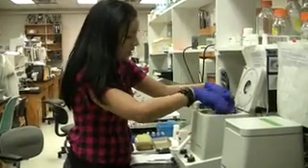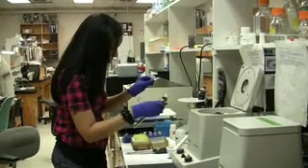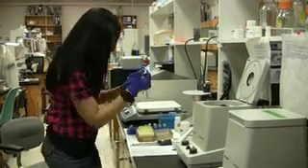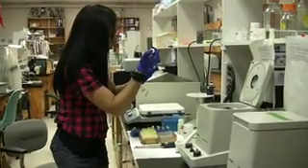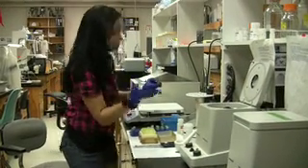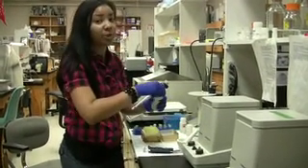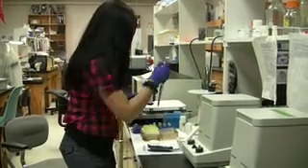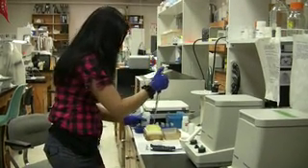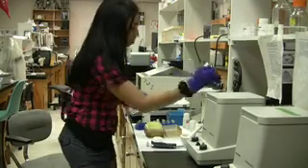I'm taking it out of the centrifuge now, it's done centrifuging for two minutes. I'm going to go ahead and transfer the flow-through without debris into this tube. After I've done that, I'm going to add 600 microliters of buffer AP3, which equals 1.5 times the volume. I'm going to put it in here and mix it a little bit by pipetting. Repeat the step for the next sample.